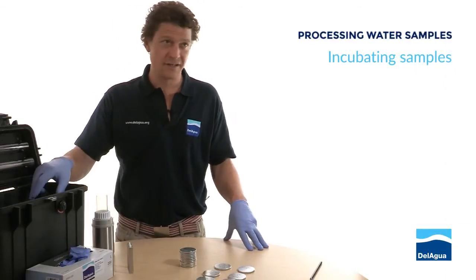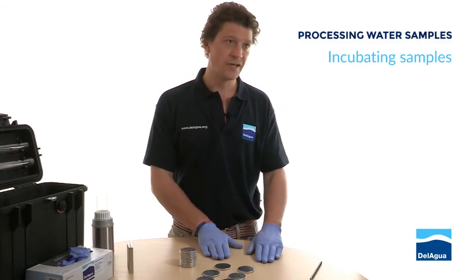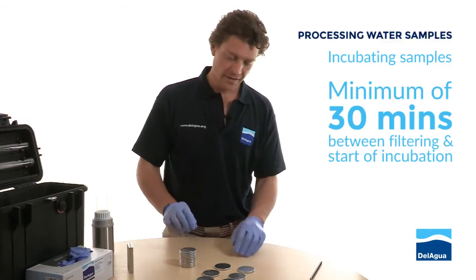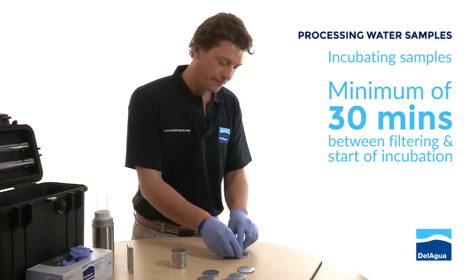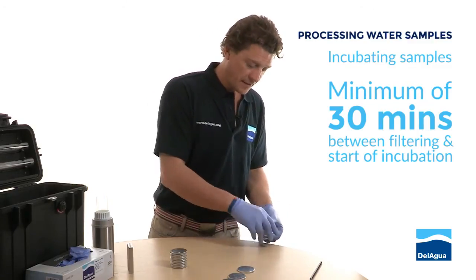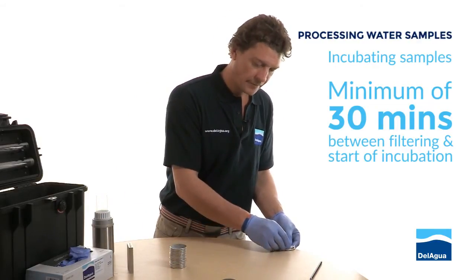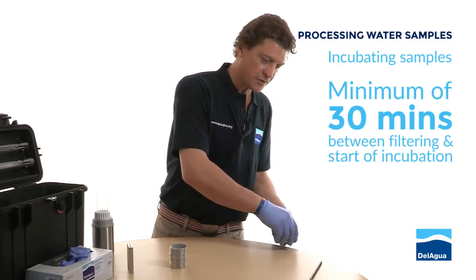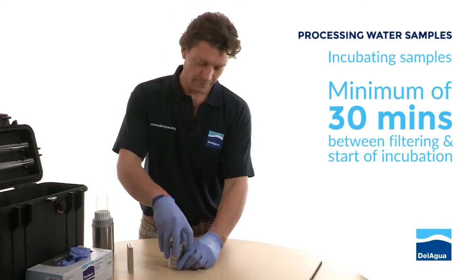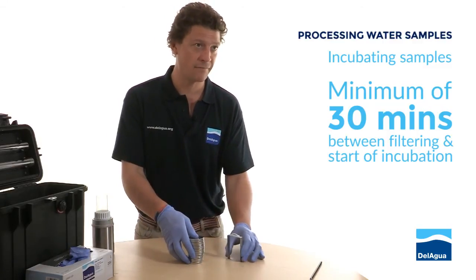The first thing to do in this stage is to turn the incubator on in order to give it some time to run up to temperature, ensuring that at least half an hour has passed since you finished processing the last sample. Take your petri dishes and slide them, keeping them flat so that the media doesn't wash the filters and pads too much. Why the half an hour? In order to allow the bacteria, which have just gone through the process of being filtered, time to recover. If they went straight into the incubator there's a possibility that the shock might do them no good and you end up with a false report.